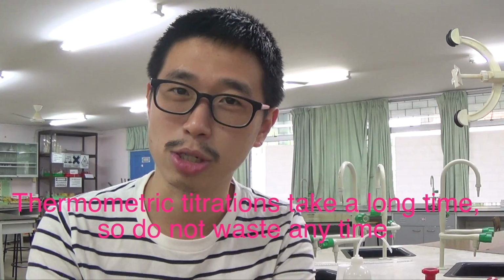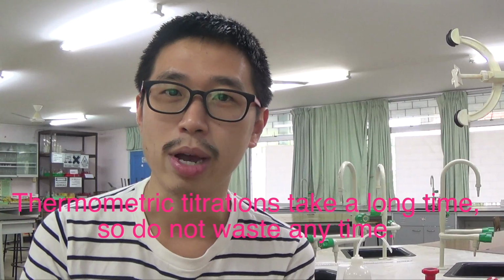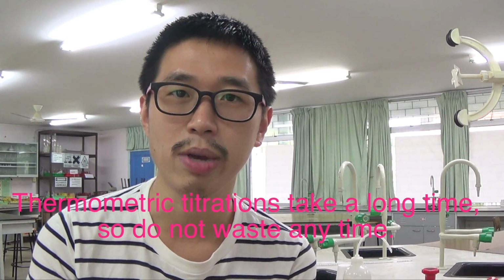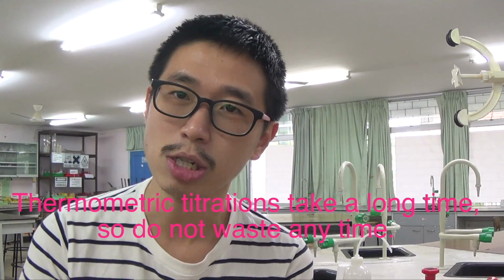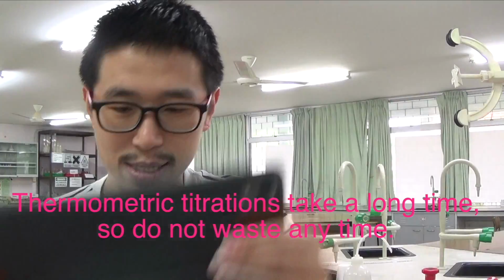This is called thermometric titration. Thermometric, something to do with thermal, something to do with temperature. We're going to be using a thermometer to measure temperature change essentially, or calculate temperature change from the temperature that we measure using the thermometer, and this will enable us to work out or determine the end point for this titration. That's why it's called thermometric titration. Without further ado, let's get started.